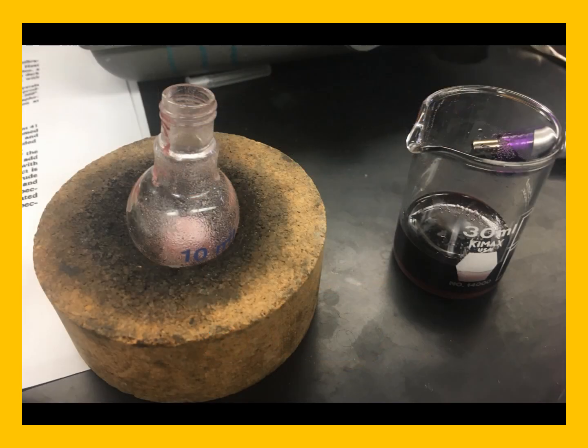You can see here that this white solid is what is left in the bottom of our round bottom flask after our first washing with petroleum ether. You can see here that we have the dark purple liquid, and underneath the dark purple liquid, if you look carefully, we have this white solid.